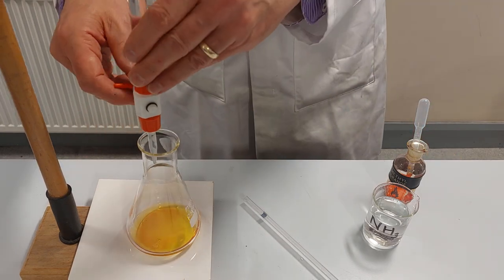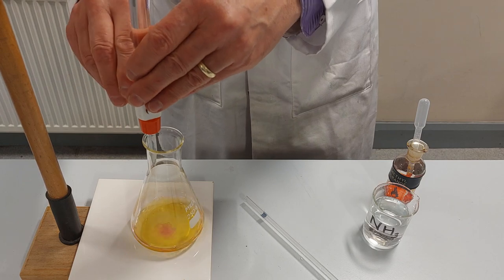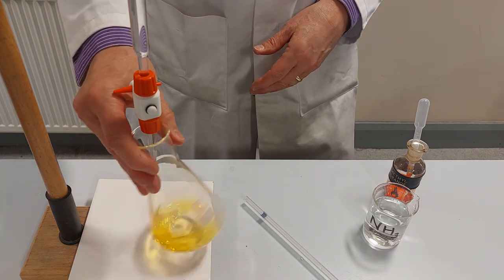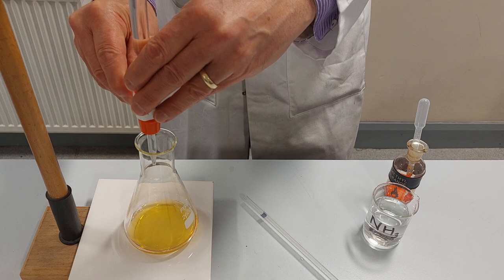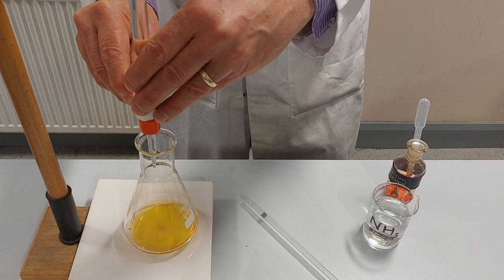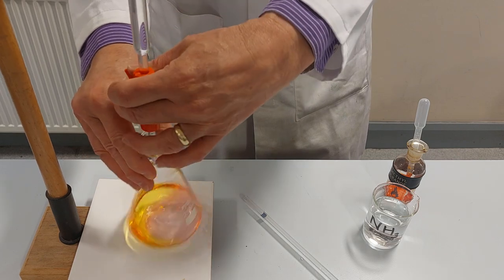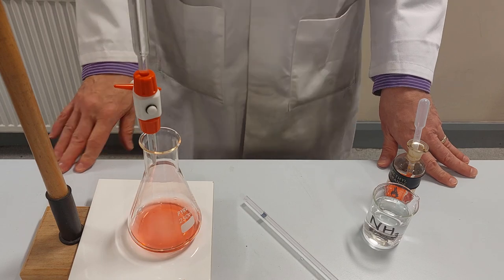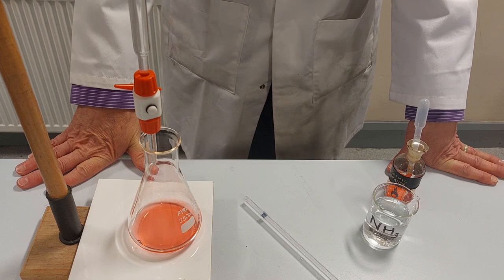Okay so I'm going to start adding acid. You can see as soon as I add the acid to the base we get some pink color but when I swirl it that goes away. So I'm going to add the acid a little bit slower and I can just control that tap there so it's coming in at about one drop a second. And that's gone much sooner than I expected.